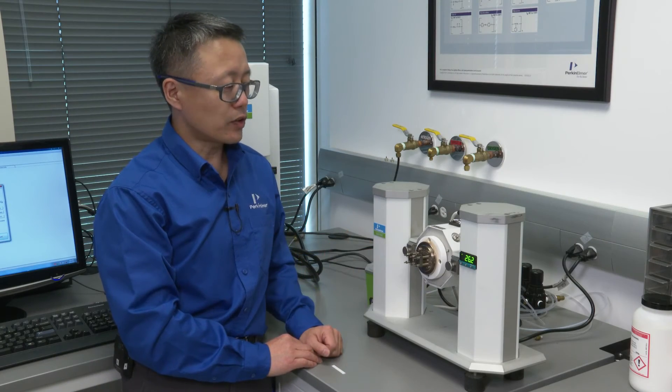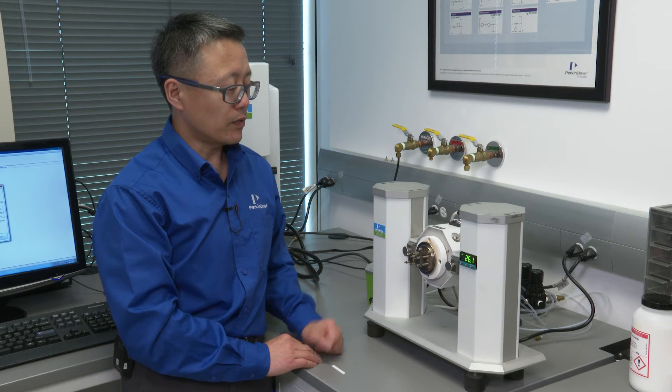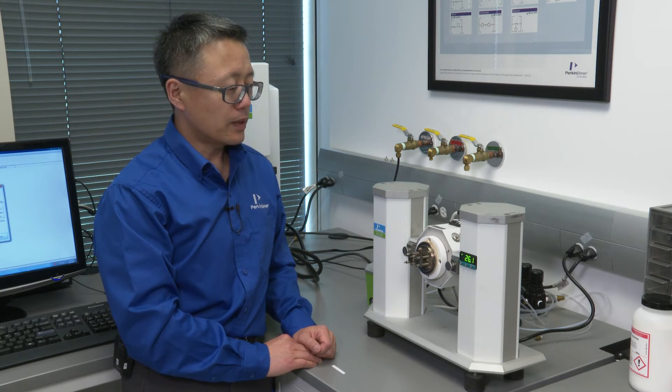Then at this horizontal position, you do the calibration of the probe with the software.